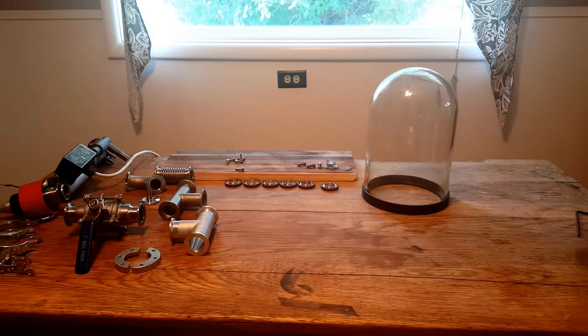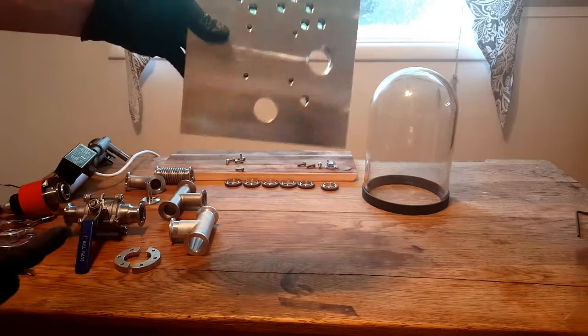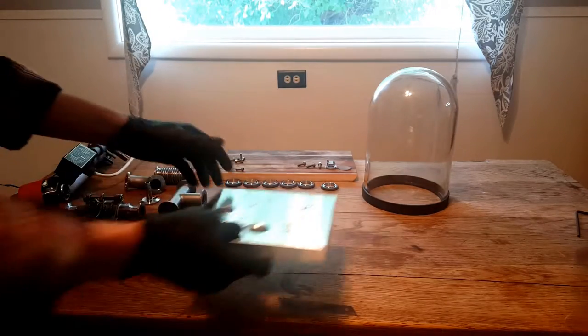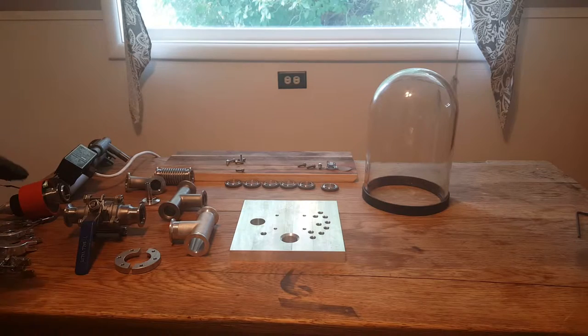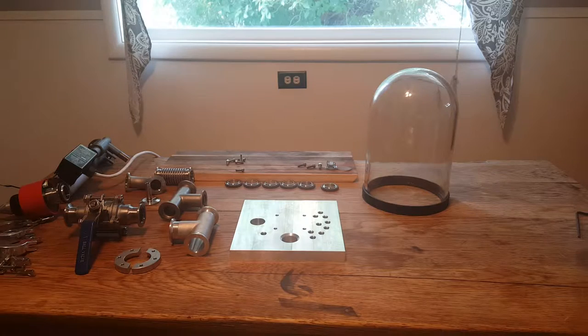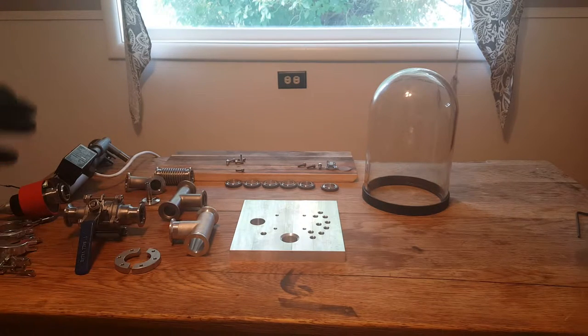As you can see, I've got a lot of vacuum parts right here. I had to machine out a base plate which just came in from e-machine shop. This is it right here — it's all custom done, designed on a CAD program and shipped out to me. Because this project is really complex, I'm going to be breaking these videos into three main parts: vacuum chamber build, the electron optics, and signal detection and processing. This is the first video in the series.